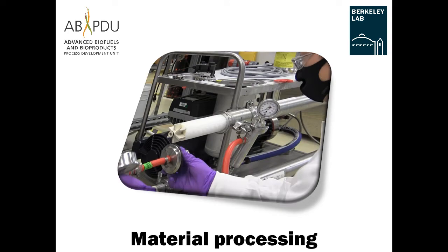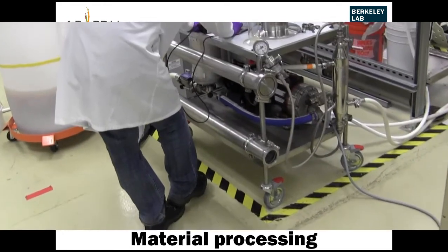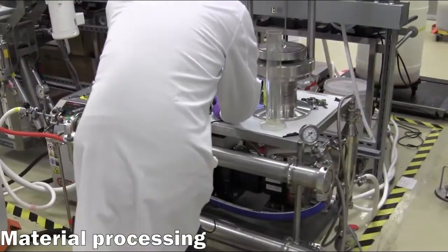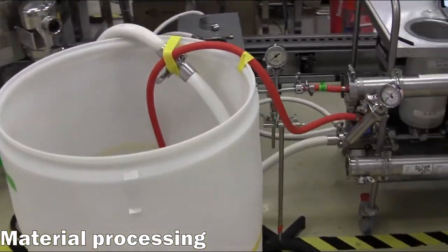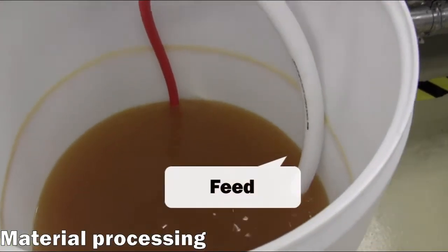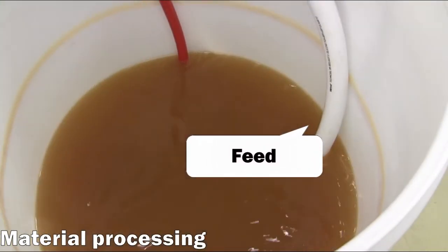Material Processing: Now that the membrane performance has been validated, the filtration of the process material may begin. The feed hose is placed in the holding vessel containing the input material, drawing material into the pump. The permeate hose is fed to a different collection vessel.